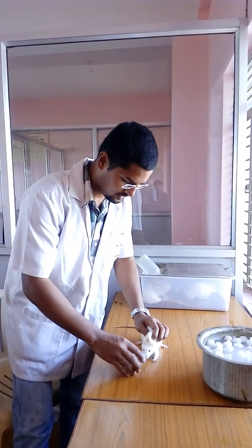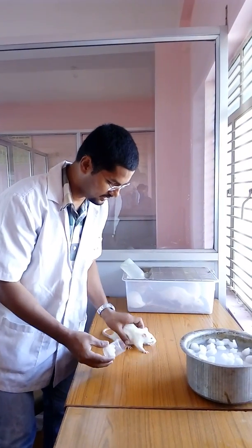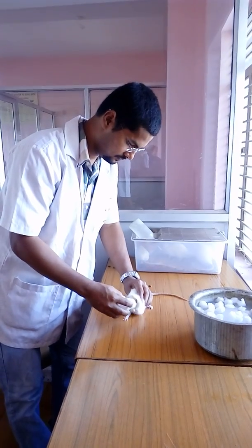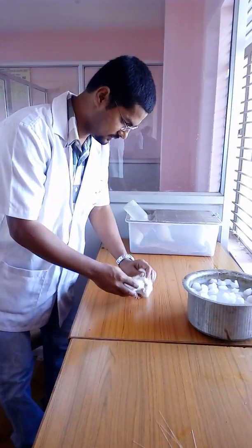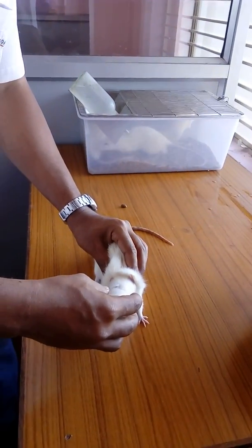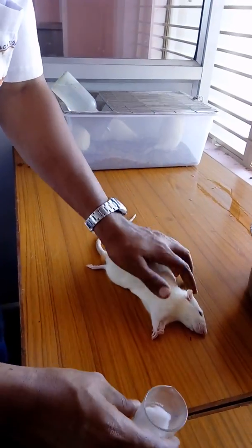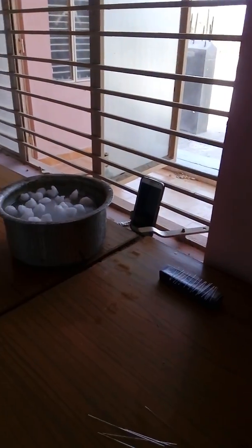Right now we are administering the anesthesia. We have to check from time to time to prevent the animal from dying. Once checked, the rat is ready for the retroorbital procedure. We must be careful with the dose — if we give too much, it will die.